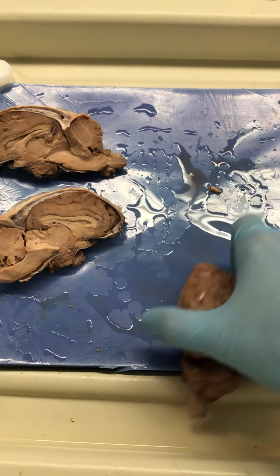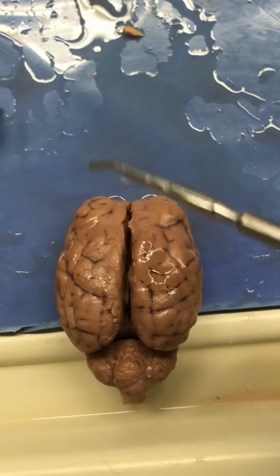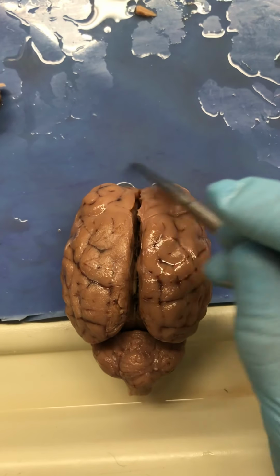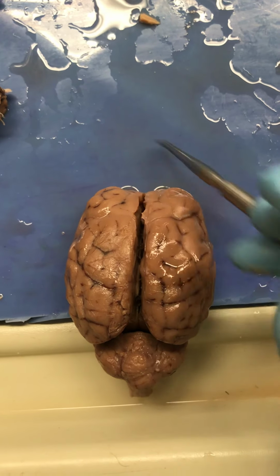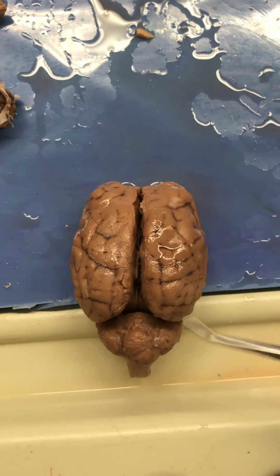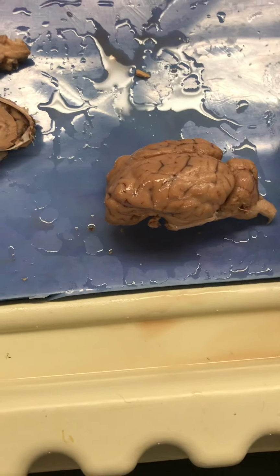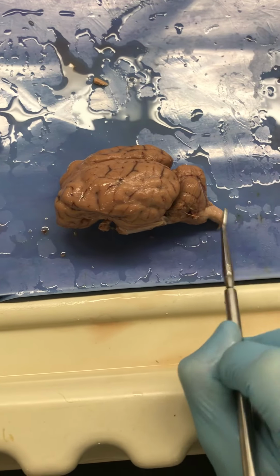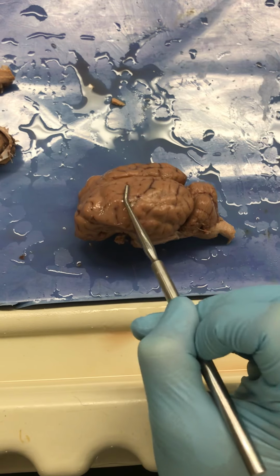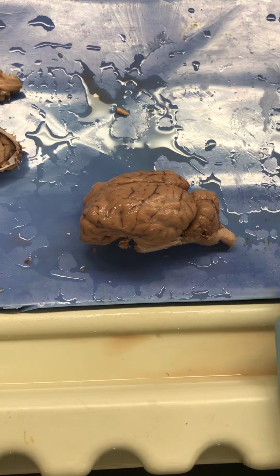Now we've got lobes that we've got to go over, and fortunately they're going to have the same names as the bones that we looked at. So this is the frontal lobe. This would be the anterior part of our brain where the nose would be and the eyeballs. This is the frontal lobe, parietal lobe, occipital lobe, and then on each side here is the temporal lobe. So this is our spinal cord, that's the posterior part. This is anterior, so there would be our nose. There's your frontal lobe, parietal lobe, occipital lobe, and the temporal lobe. Those are the only ones you need to know.